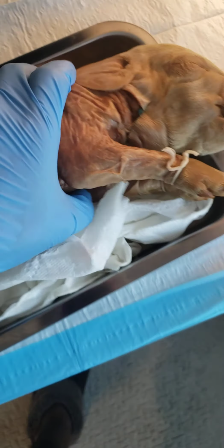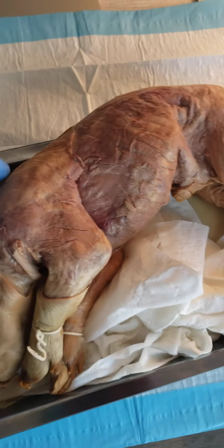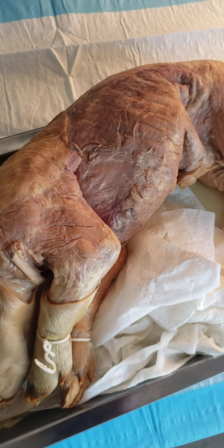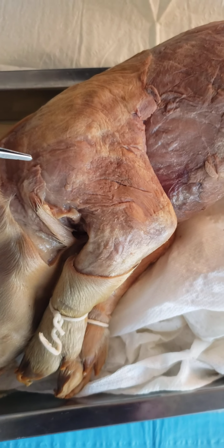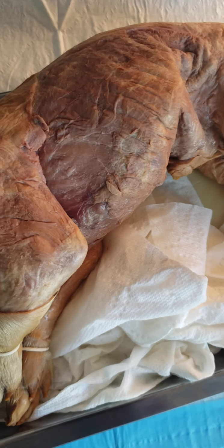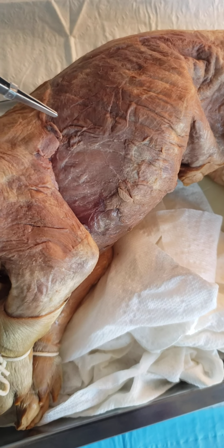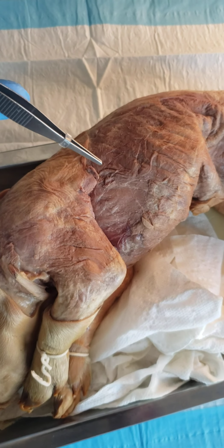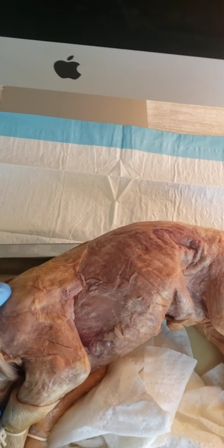Let's see if we can get a better picture of it on the other side. A little bit better right here. Kind of see the deltoid region right there, and see if we can get a better view of the latissimus dorsi. It's going to be about right here in this region, much like your lats on a human working the lat pull downs.